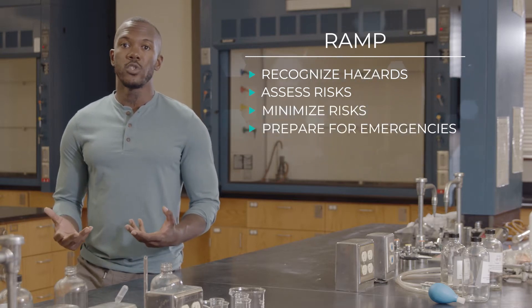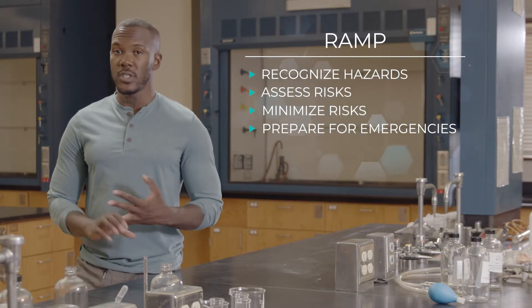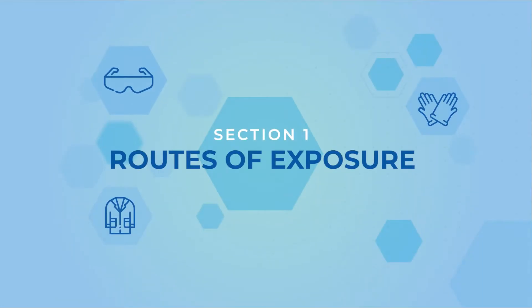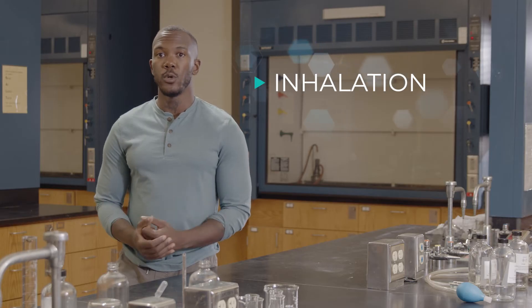For this video, we'll assume you've already completed the first two steps of RAMP: Recognize Hazards and Assess Risks. The first step in minimizing risk is to think about how you could be exposed to chemicals in the lab. There are four ways chemicals can enter your body. The first is inhalation, the most common route of exposure.